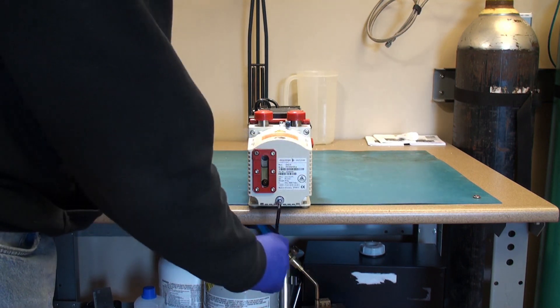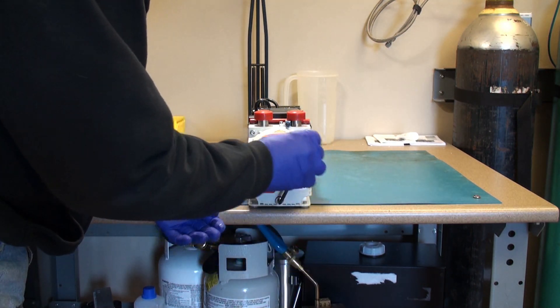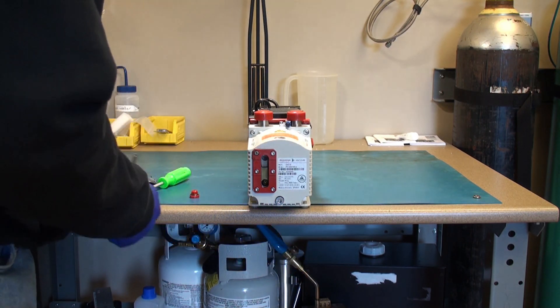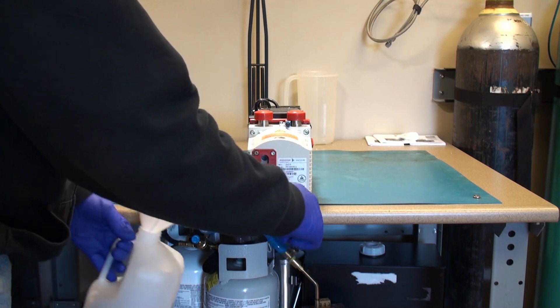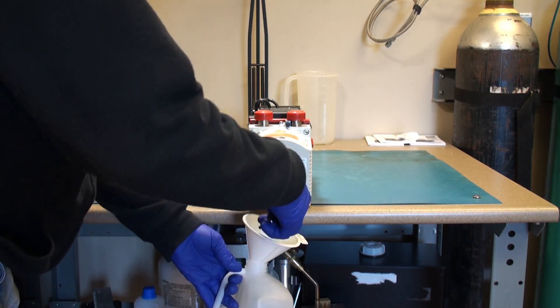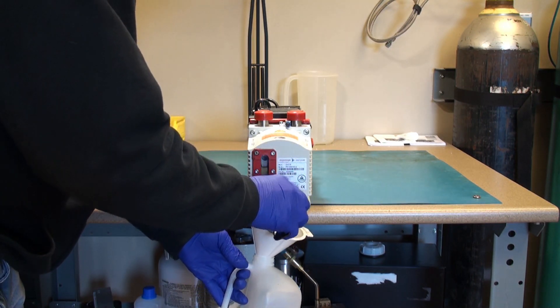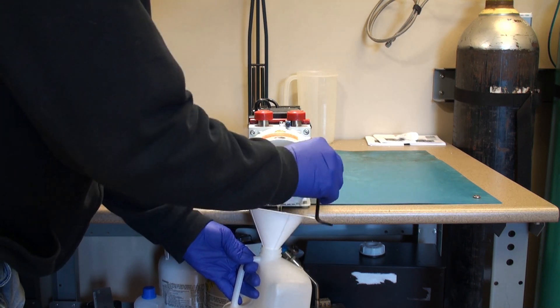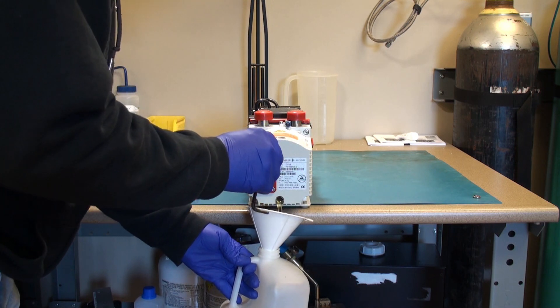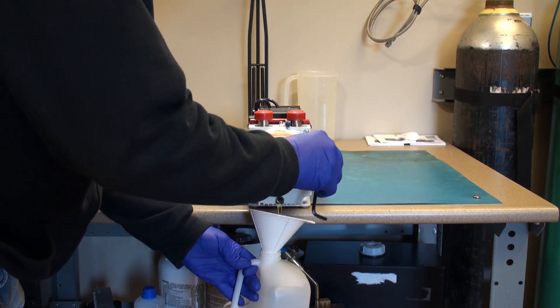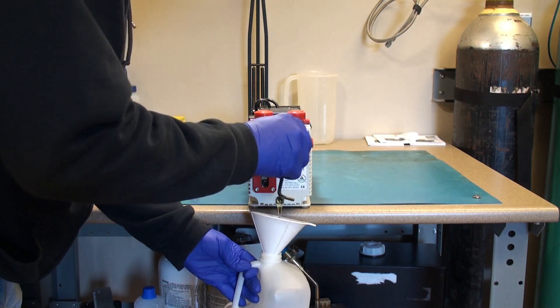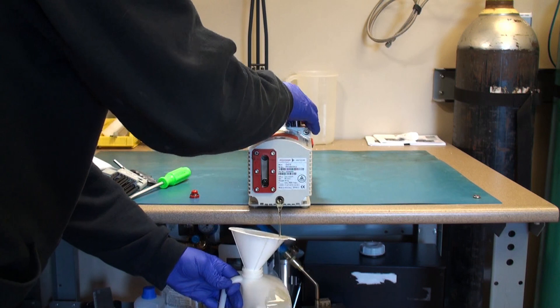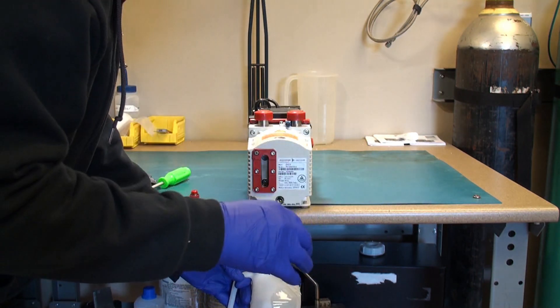So using the allen key I loosen the drain port and then move it the rest of the way, allowing the oil to drain out. So what I mean about getting messy.